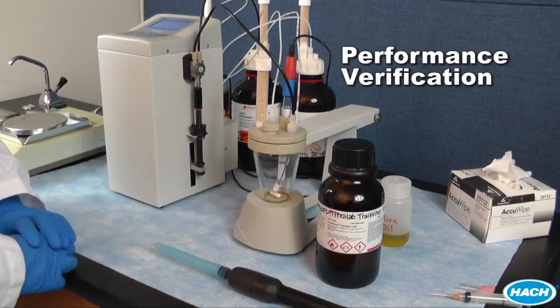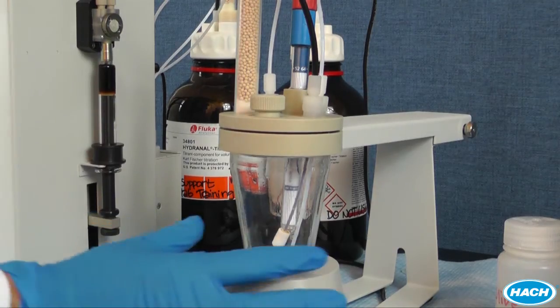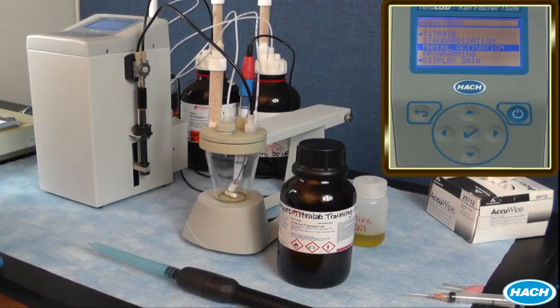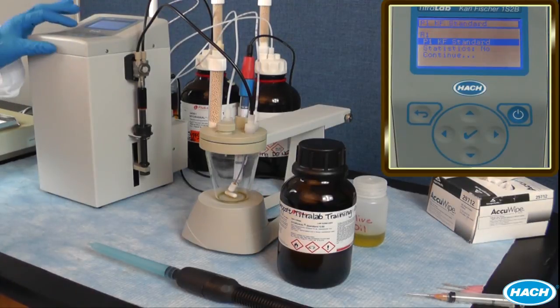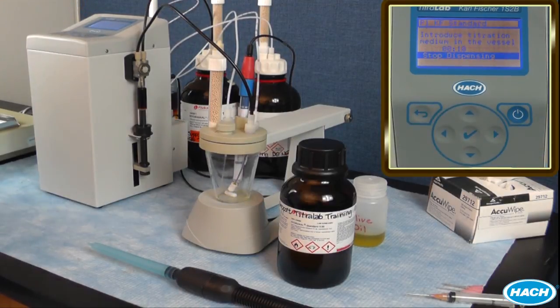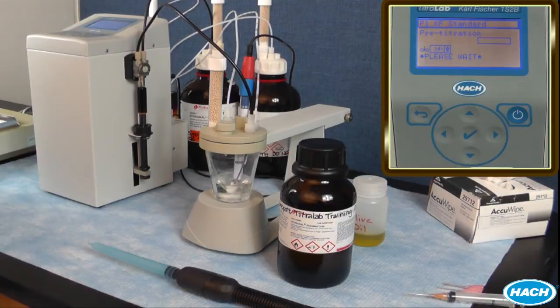It is good practice to verify your analysis with a known standard at least once a week. You may need to recalibrate your titrant if the results do not meet your specifications. Begin by making sure the waste tube is pulled up to the top of the cell to prevent contamination. Select Titrate, then select P1KF Standard, and select Continue. Select Dispense Solvent — the titrator will automatically dispense the correct volume of solvent. When it is finished dispensing, press Continue. A pre-titration step now occurs where titrant is dispensed into the cell to remove any residual water from the solvent.